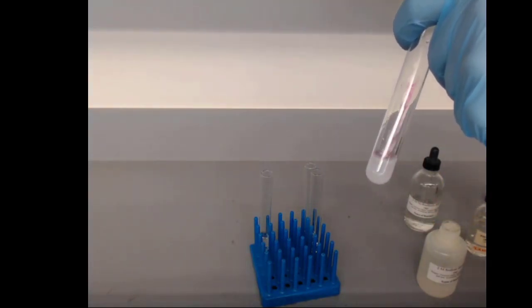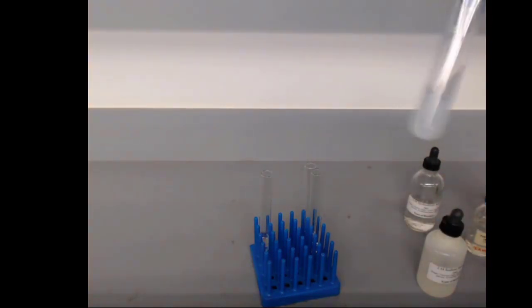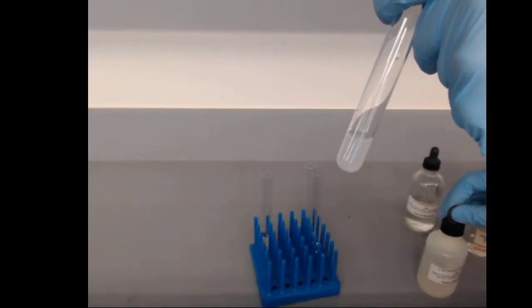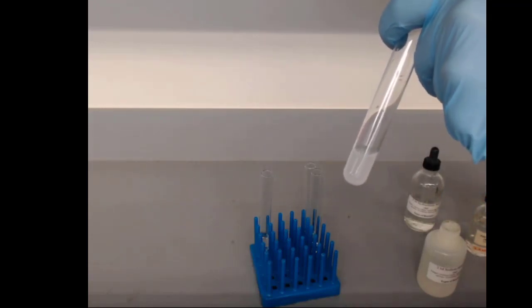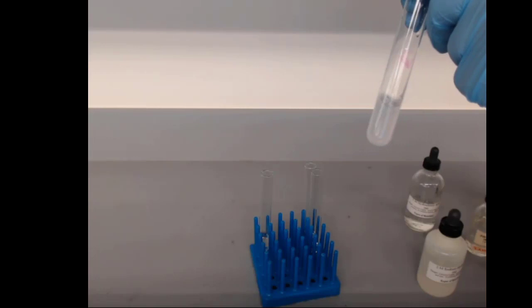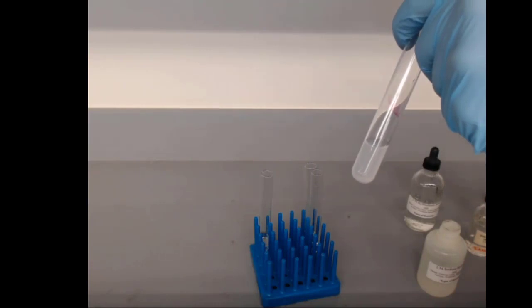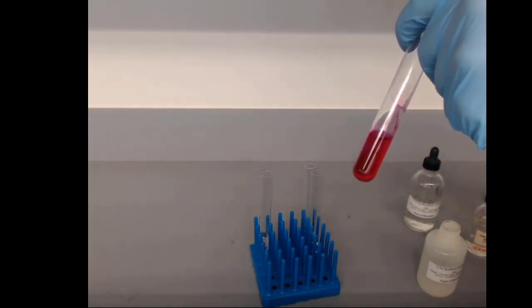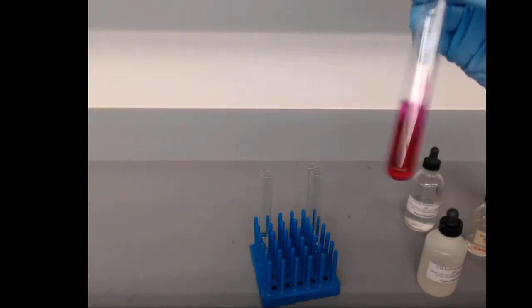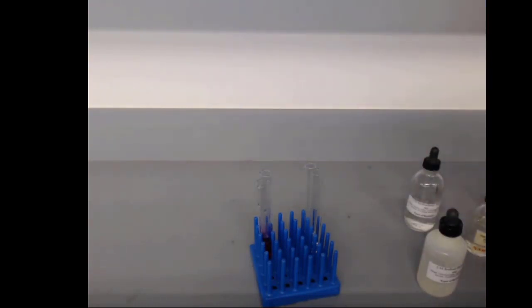But phenolphthalein in acidic conditions has one particular color. And then as we add the sodium hydroxide, you see the sodium hydroxide turns it that bright pink color, but I didn't add enough sodium hydroxide to completely react the acid away. So it goes back to clear. Right? That's getting to the idea of extent of reaction. And a little shake. Once the solution stays pink, I'll know that all of the acid has reacted, and I've got excess base. Phenolphthalein makes it so we've got this nice visual change associated with it.